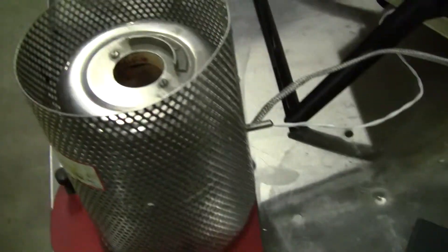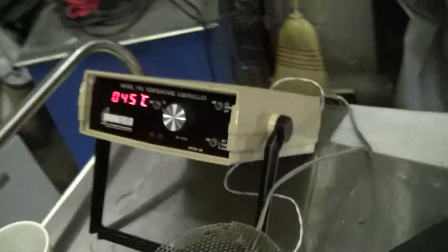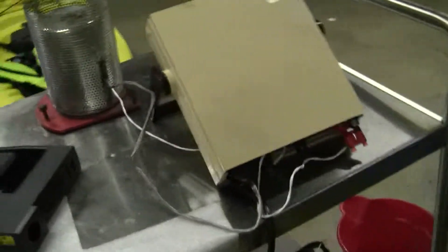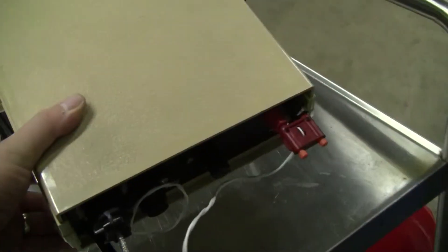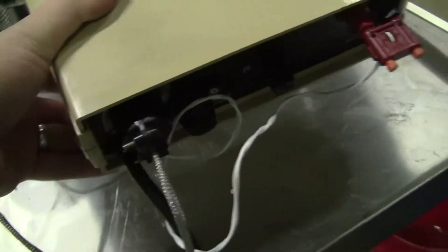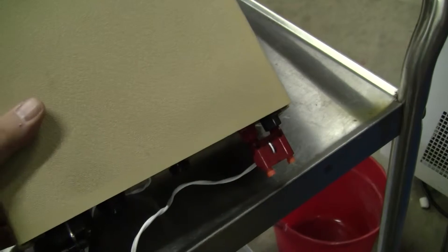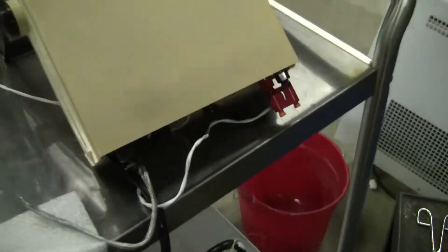So, this unit runs off 115 volts. There's the rear of the unit, that's where your heater plug goes into, fuse, and where your thermocouple goes.